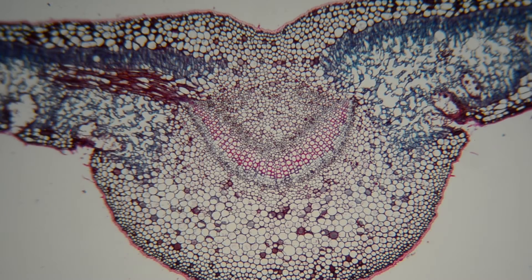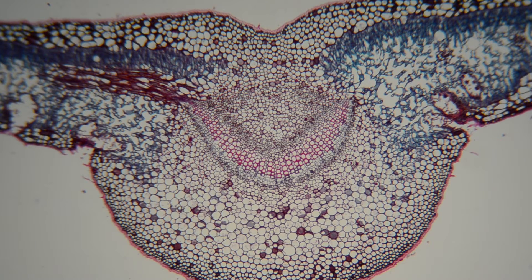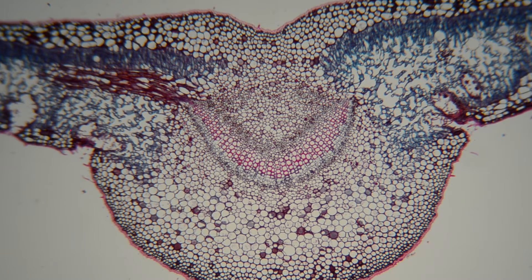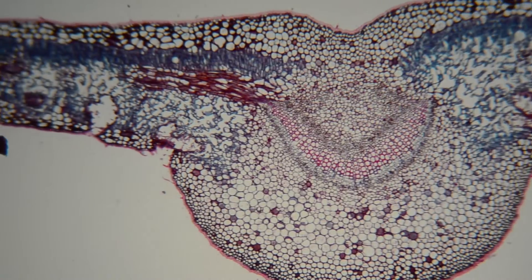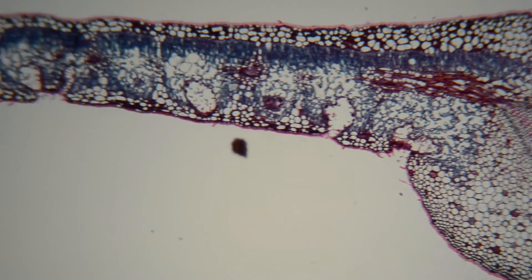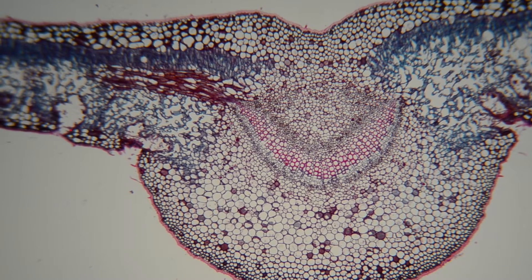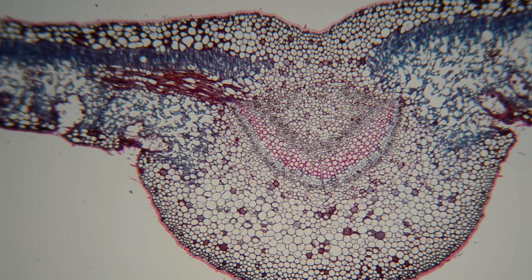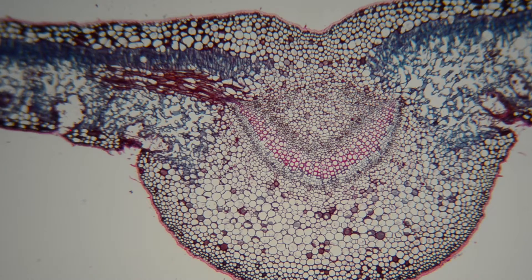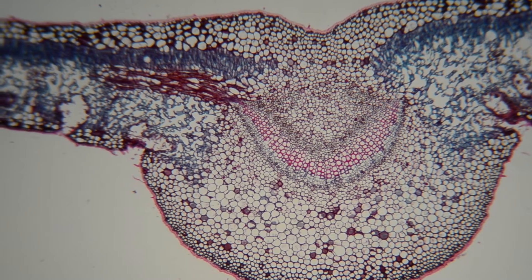Today we're looking at a leaf cross section. It's been stained so that we can see the different parts quite clearly, and that is one of the veins that contains some specialised cells for movement of liquid around the whole of the plant.